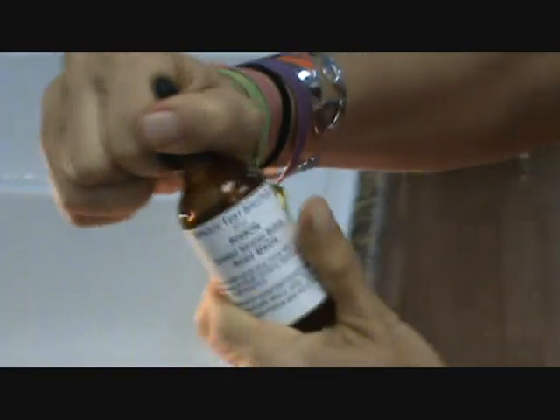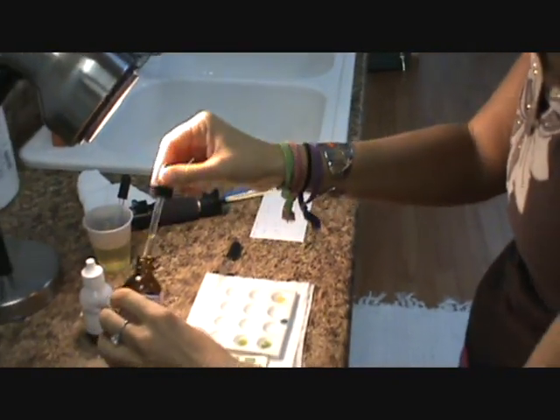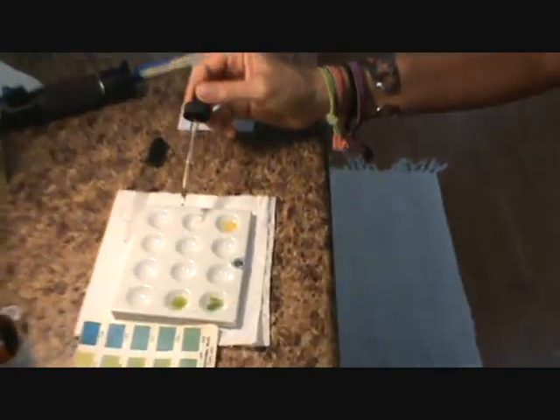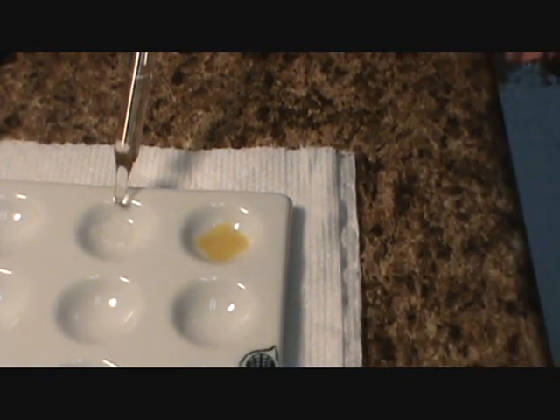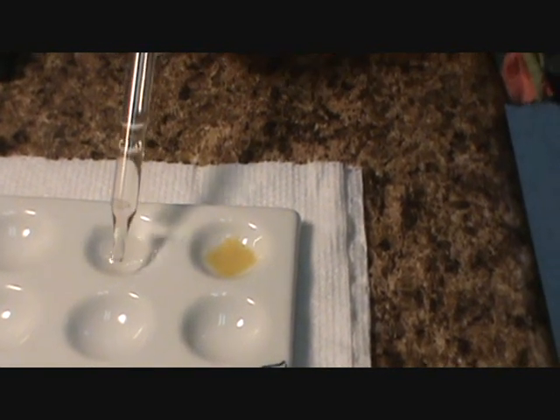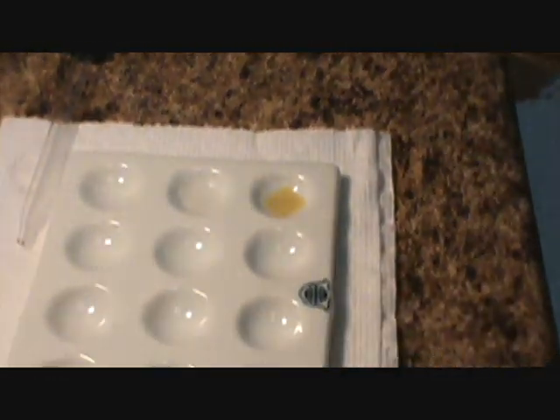On to the next urea. Now we're going to take the nitrate test solution, which is quite poisonous, so this stuff is high octane — you want to be careful with this. We're going to do the same thing again, go around the clock — north, east, south, and west. And that one takes five minutes, so we'll get back with you in five.